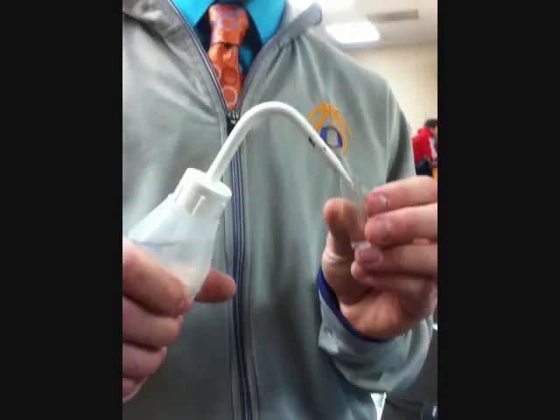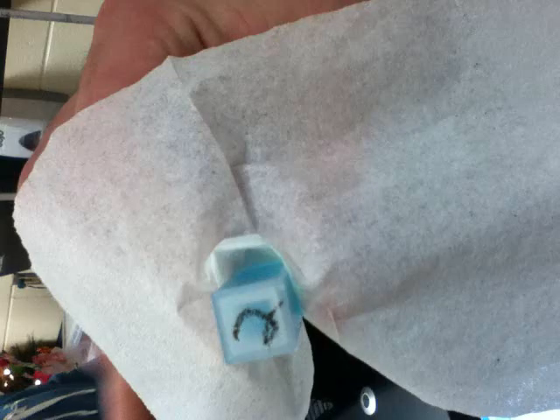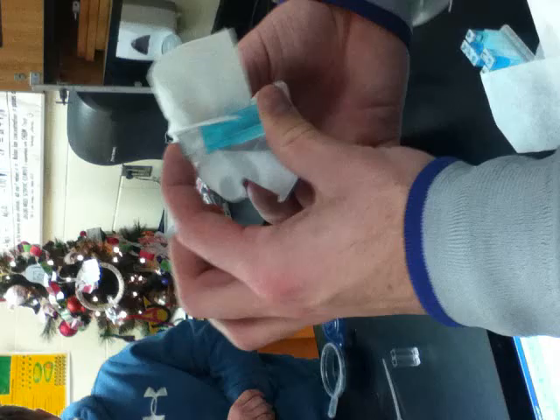Place the cuvette of distilled water into the colorimeter and press the blue cal button. Your absorbance on the computer screen should be at 0.00. Push start on the screen to begin collecting. Place each cuvette into the colorimeter. Press keep and enter the appropriate concentration. After you've entered all 6 data points, push the stop button.